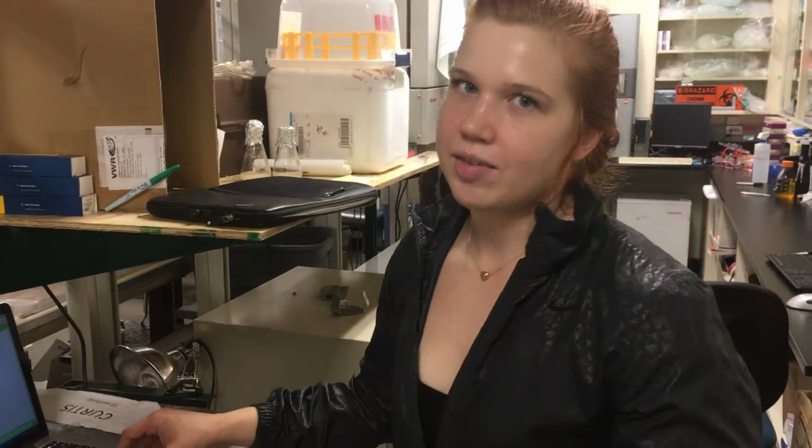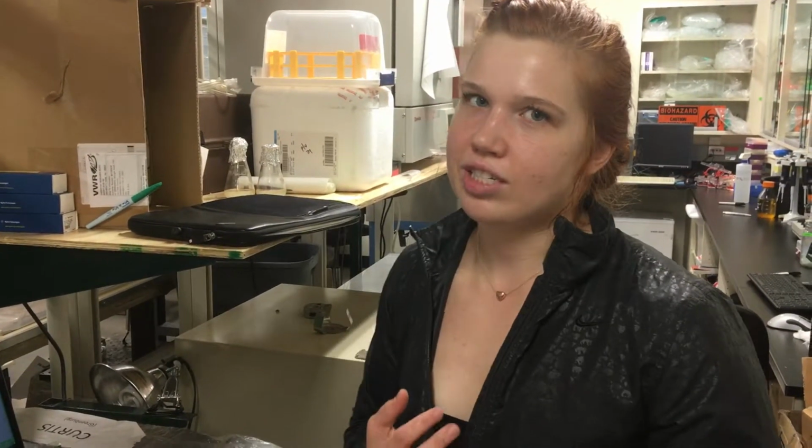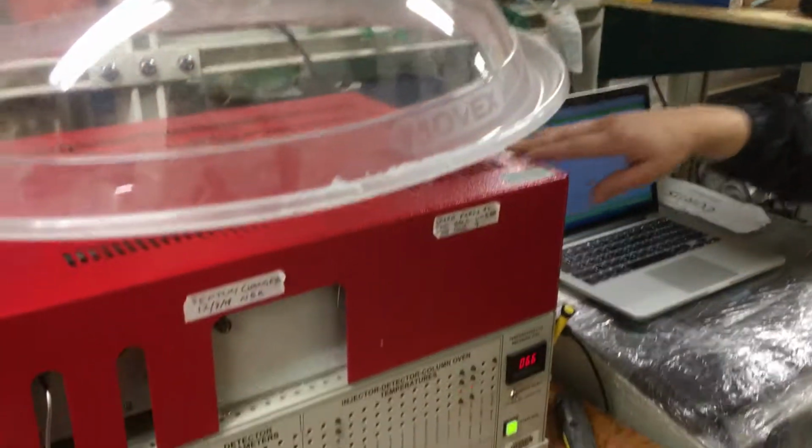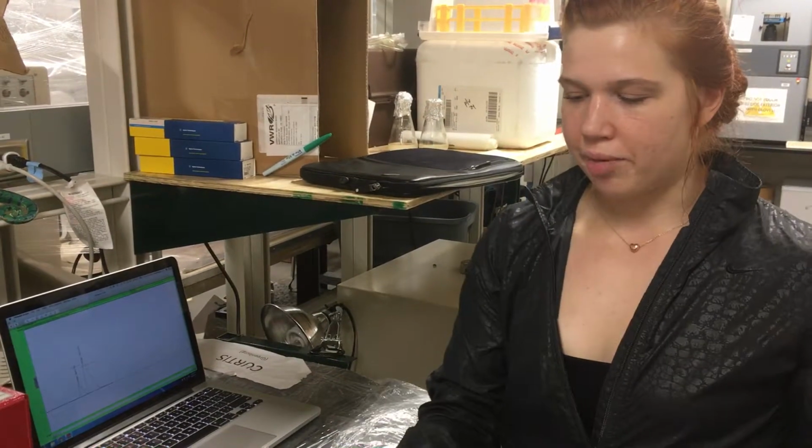So I'm Sarah Jean. I'm a graduate student in CurtisLab, and I'm going to talk to you about PeakSimple and GC. PeakSimple is a software that we use to connect to this GC to analyze the data. So right now we have a run. Well, first of all, let me back up.